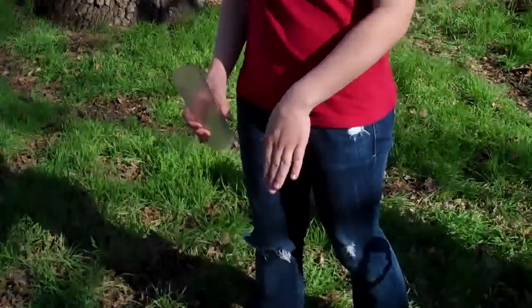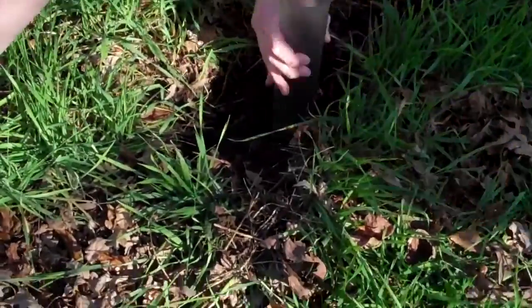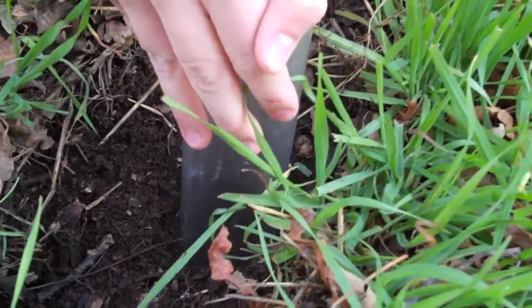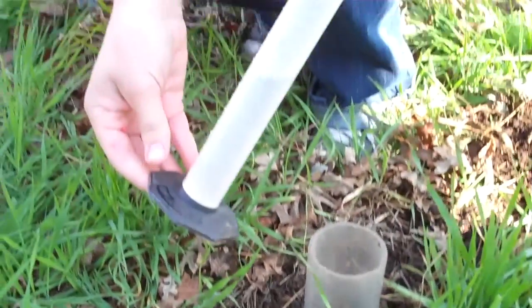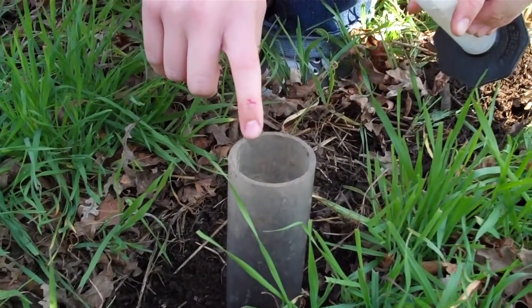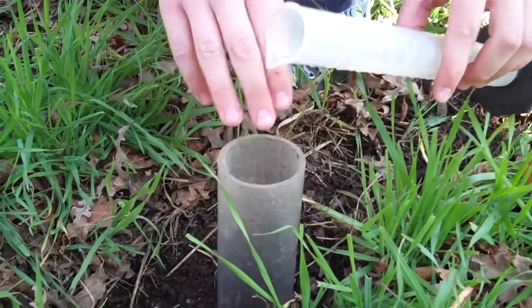In order to determine the water infiltration, you need to take an open-ended cylinder. After you've cleared an area on the ground, you're going to insert your cylinder into the ground using a hammer and a block. Once the open cylinder has been placed into the ground, you're going to take 52 milliliters of water, which is equal to 1 acre inch, and fill the open-ended cylinder. As soon as the cylinder is full of water, you're going to start recording the time it takes for all of the water to seep into the dirt.